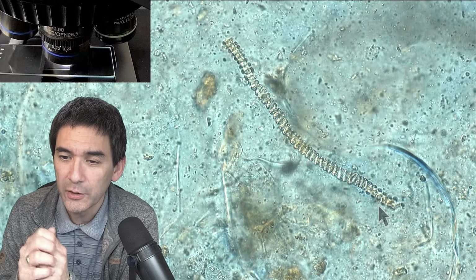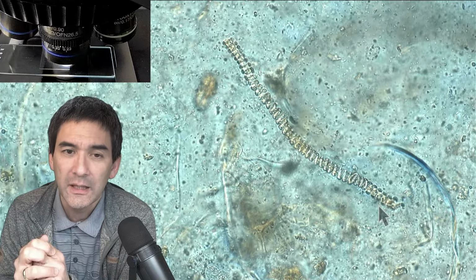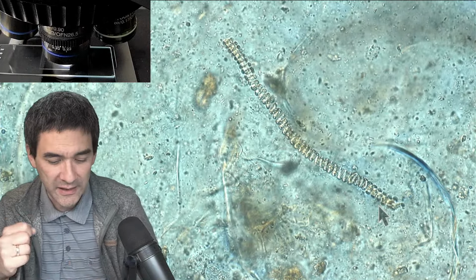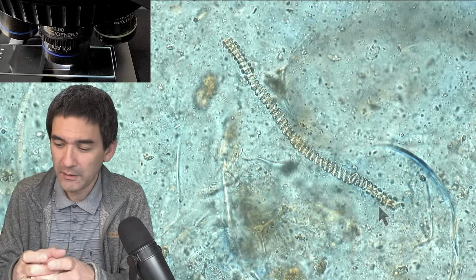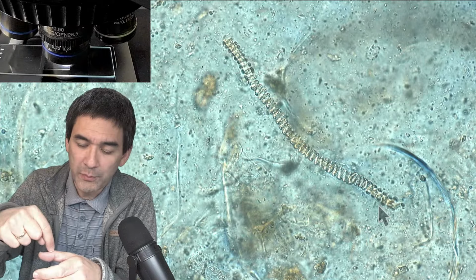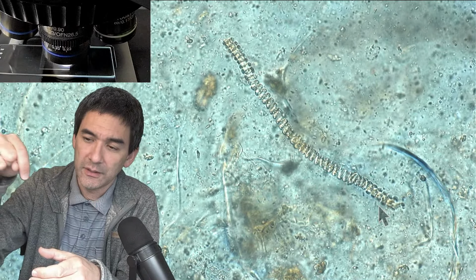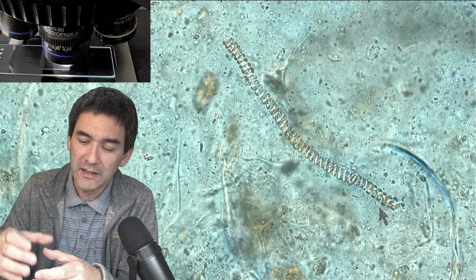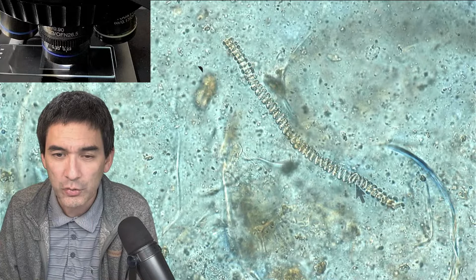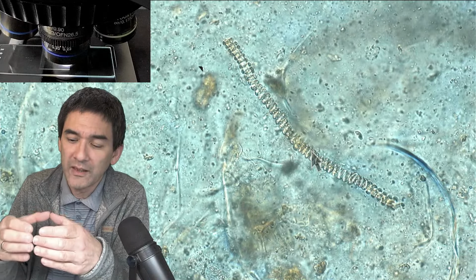The question is if the job is to transport water, why are they coiled? Wouldn't a shorter path be more effective? The water is not transported in the spiral. So you have to understand it like this: that you have a tube, right? These are the cells where the water is transported, and the spiral is on the outside, in the cell wall. Okay, basically it's transported in the middle, so to say, right? So the water does not travel in a spiral way, but actually in the middle here. And what we see here is simply the strengthening on the outside.